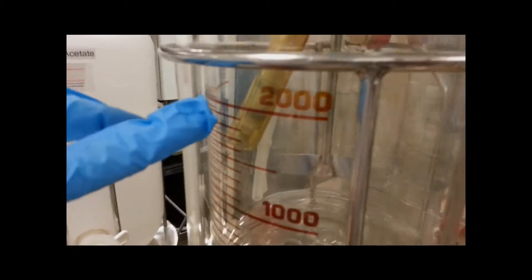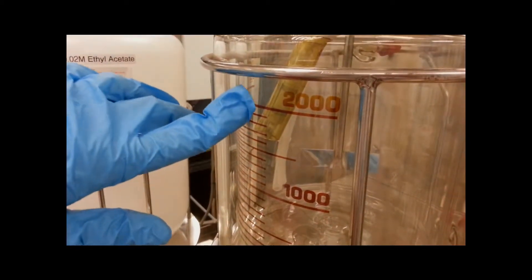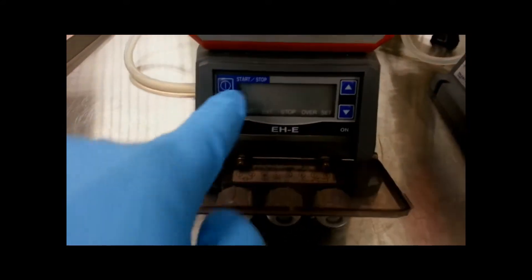After the level has reached 2,000 ml, you are required to stop both pumps at the same time.